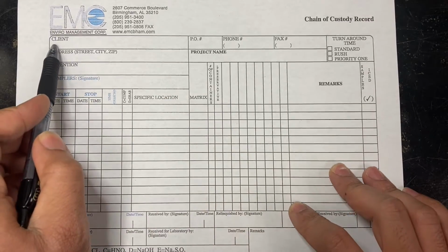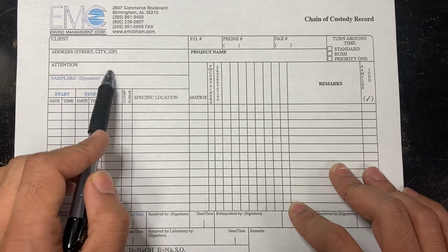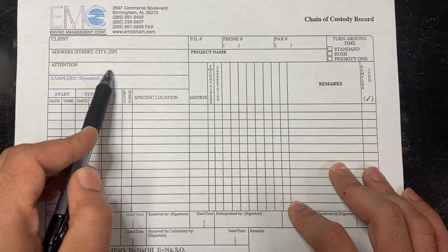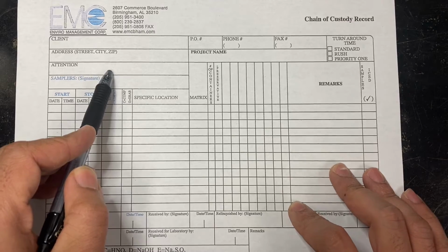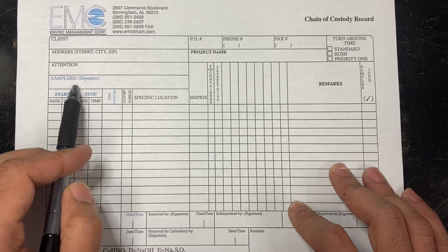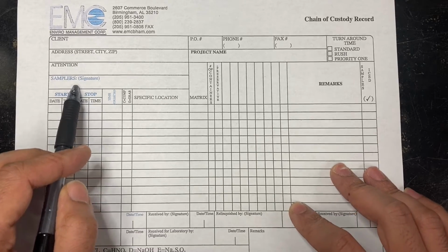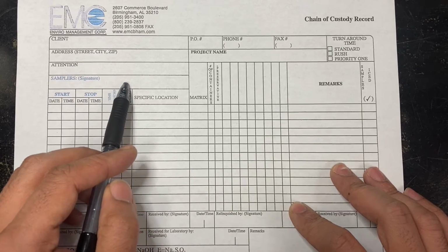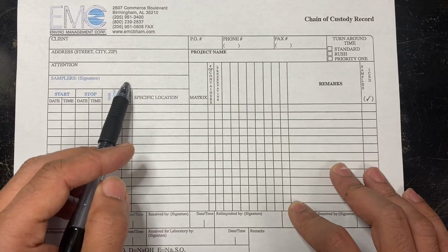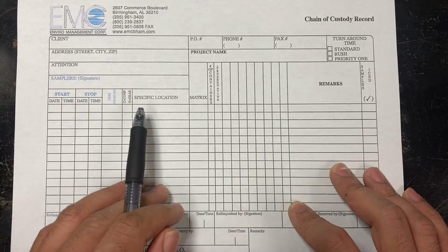So your client would put their information here as well as their address, and attention it to maybe a lab personnel, if they have a relationship with someone here at our lab, they need a sample to go specifically somewhere, or it has to have a rush. Now, if the sample was a grab, that means that someone actually went out and got the sample. We would require their signature here, just so if there was any type of situation where we couldn't identify a sample, we know who to talk to. We talk to the sampler.